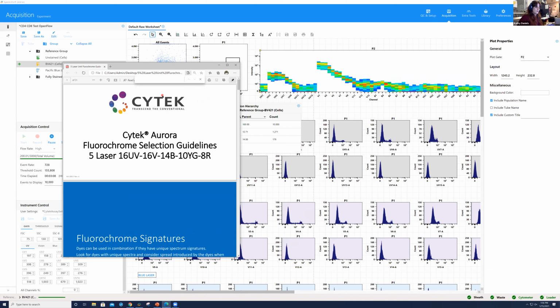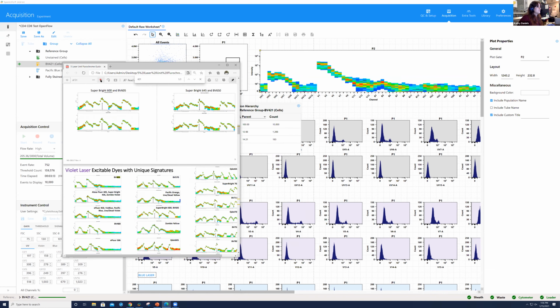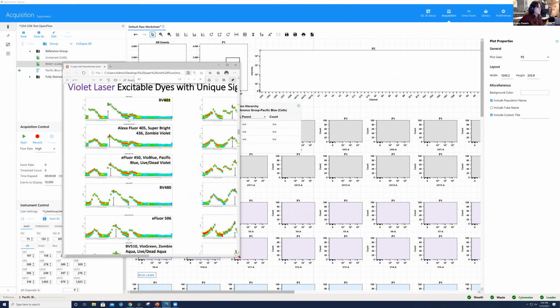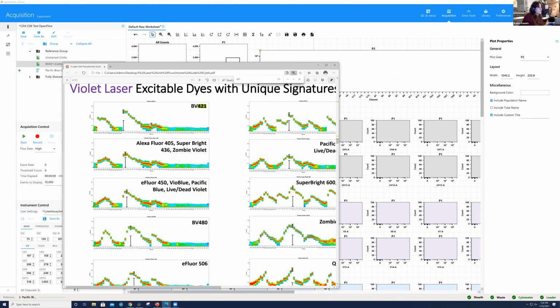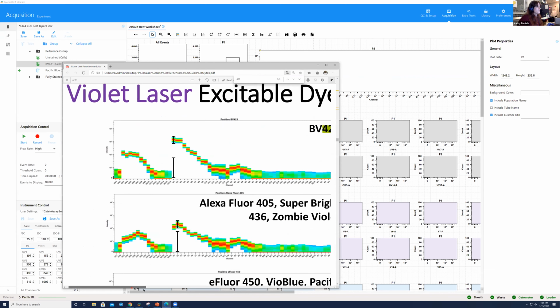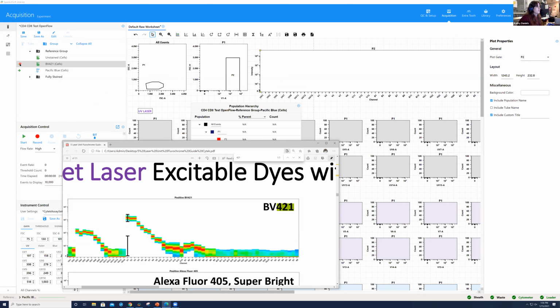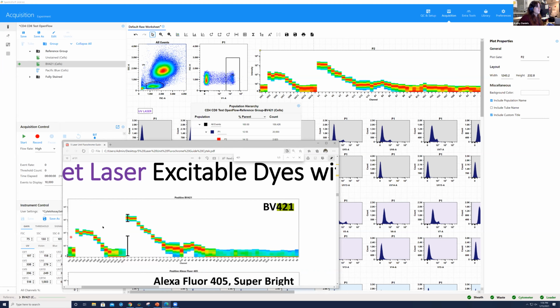So if you hit Control F, you can search for that fluorochrome, right? And then you can see BV421 pops up. It's going to be very small on your computer, so I'm going to make this as large as I can for everybody. But what we see is the known fluorescent signature of BV421. So if I click on it in the software and then open it up here, what we should see is that these signatures match up.